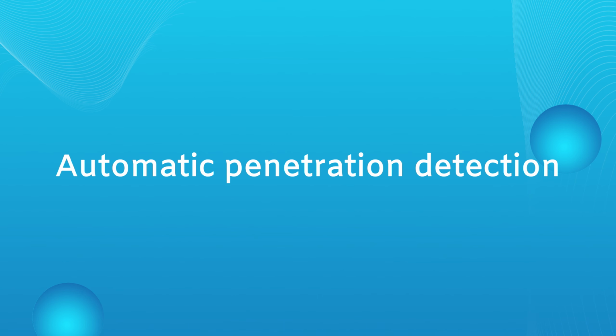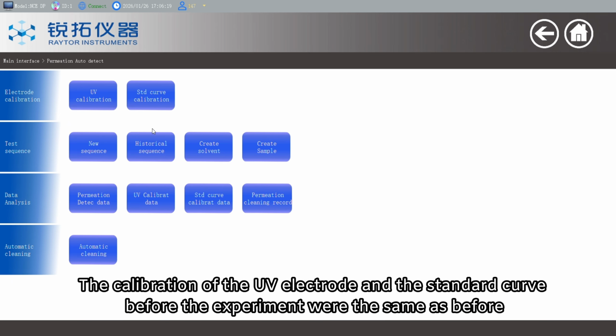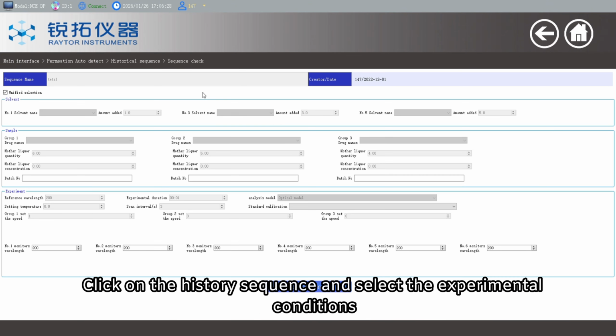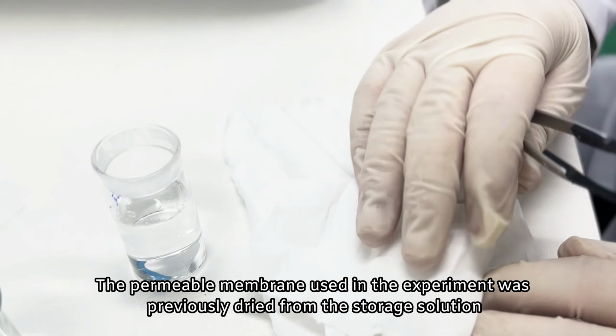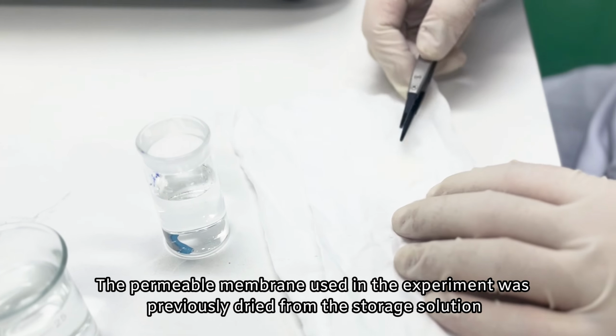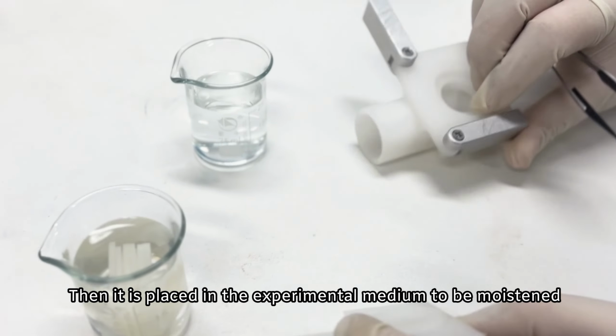Automatic penetration detection. The calibration of the UV electrode and the standard curve before the experiment were the same as before. Click on the history sequence and select the experimental conditions. The permeable membrane used in the experiment was previously dried from the storage solution. Then it is placed in the experimental medium to be moistened.